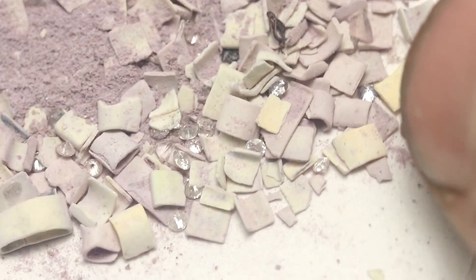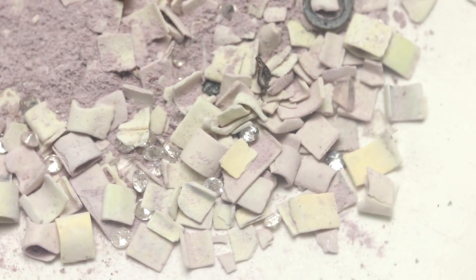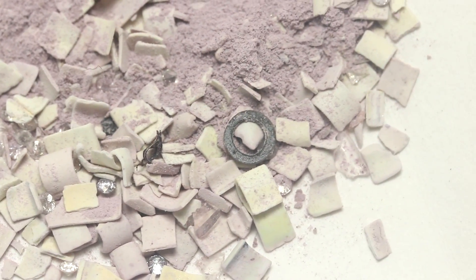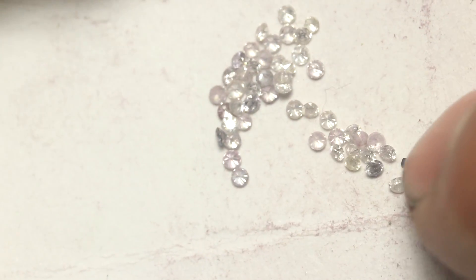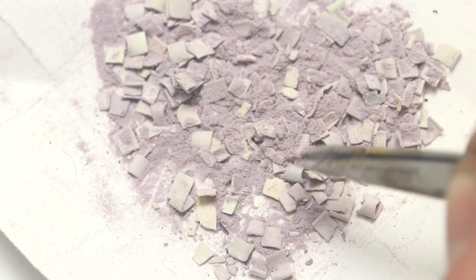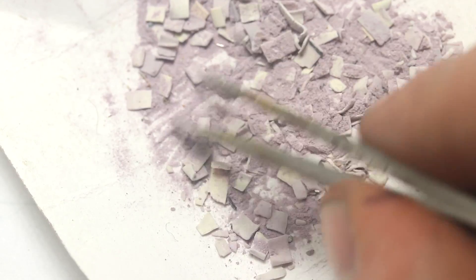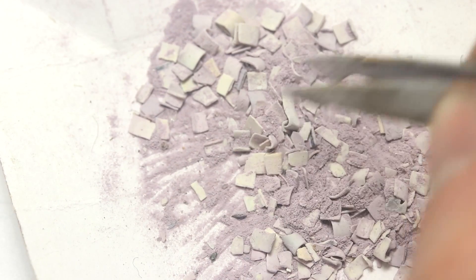Let's look at what didn't dissolve in the acid. This is primarily silver chloride sponge mixed with diamonds, broken glass, and what looks to be some pieces of stainless steel. Let's start by sorting out all those gems. Here are the diamonds that came out of the watch — as you can see, they're not very big. Now I should be left with mostly silver chloride, although there's still a bunch of little bits of junk in with it. I'm going to dissolve all the silver chloride in ammonia.